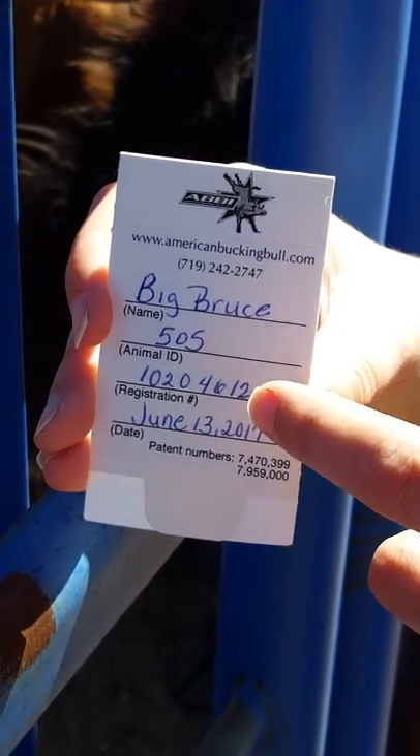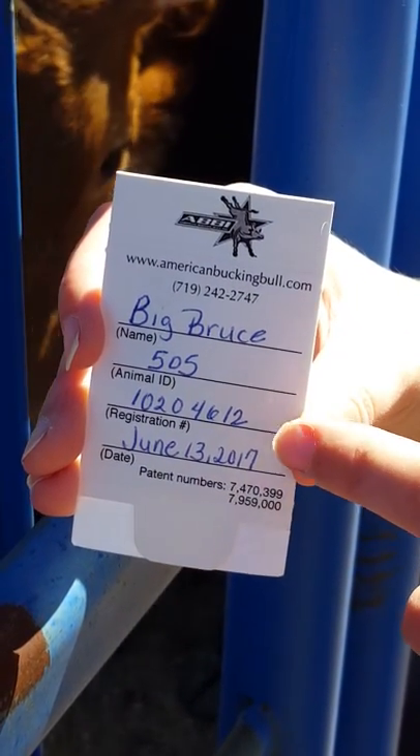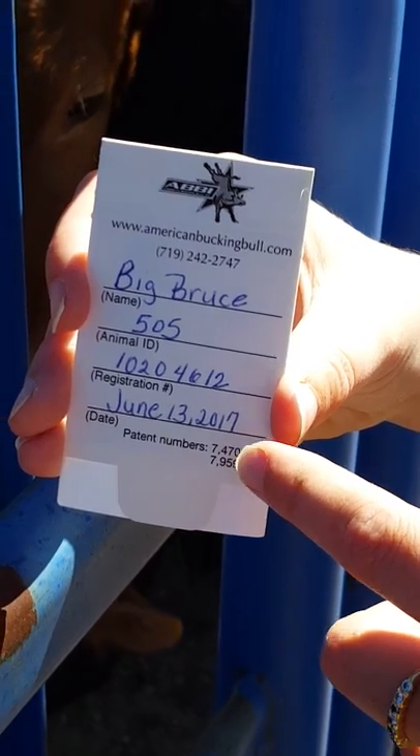And if you don't have a submission online and you send in the paperwork, you'll leave that blank. And then you have the date that the sample was pulled, so we know how long the sample can last.